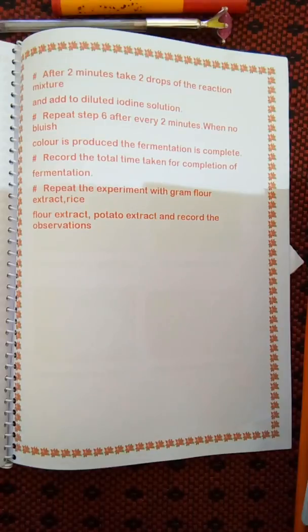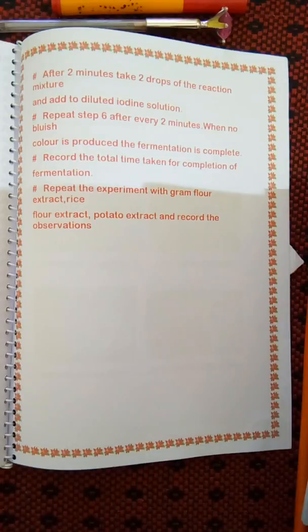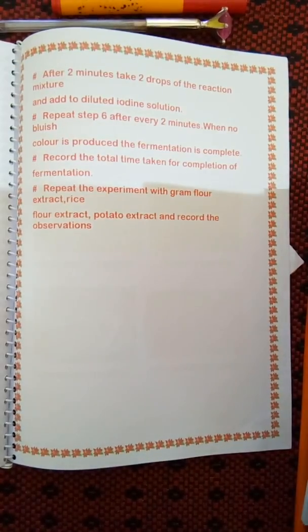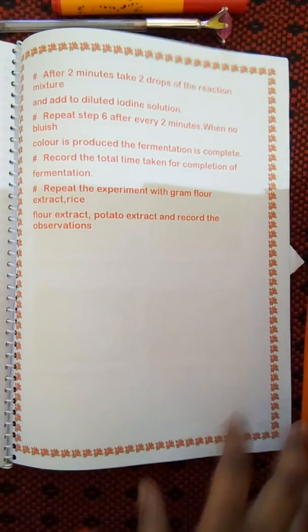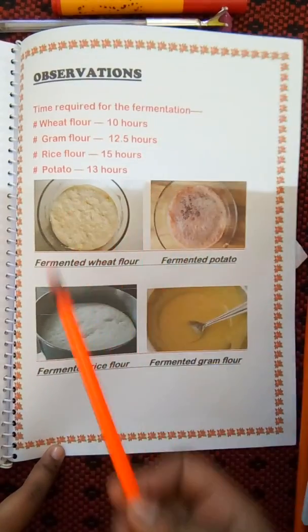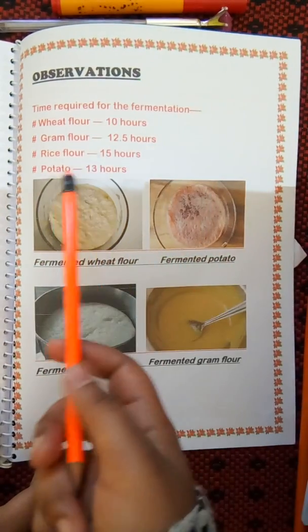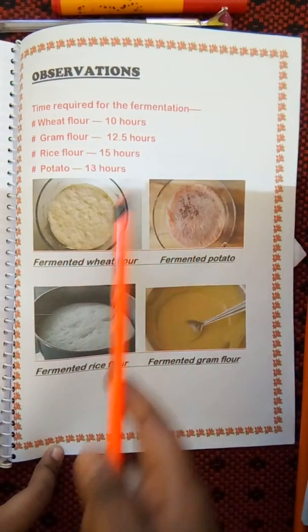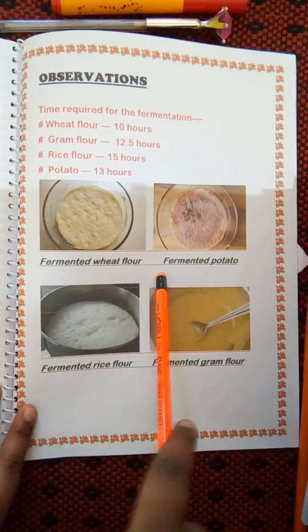The blue-violet color of iodine disappears when the starch is fully fermented; when partially fermented, it remains blue-violet. I wrote all those steps. In the observation page, I recorded: wheat flour took 10 hours to ferment, gram flour took 12.5 hours, rice flour took 15 hours, and potato took 13 hours. I also pasted photos of those fermented food samples.